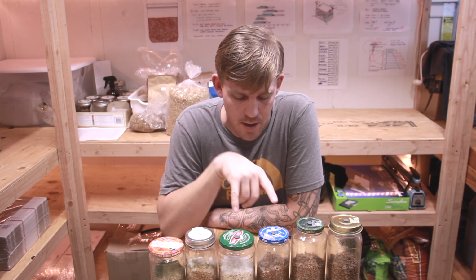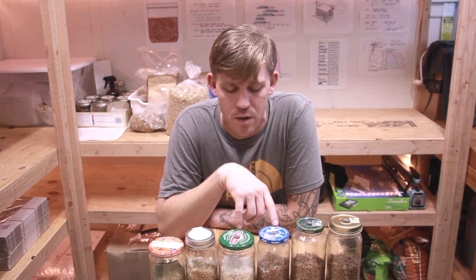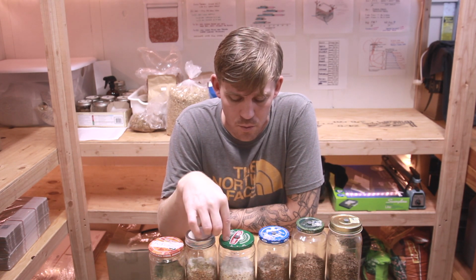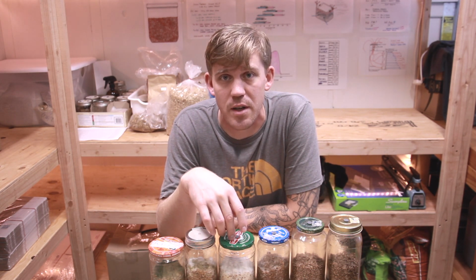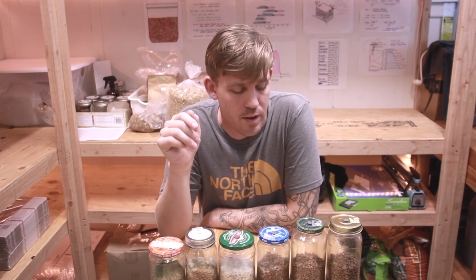So I think that these two jars, which again were boiled instead of pressure cooked, I boiled the jars for 30 minutes instead of pressure cooking them, are full of wet rot. But I'm going to make one last-ditch effort on jar 3 here. I'll give it a shake, see how the grain looks, and if it's looking clean, then I might actually have some success with that. We'll look at that in a second.